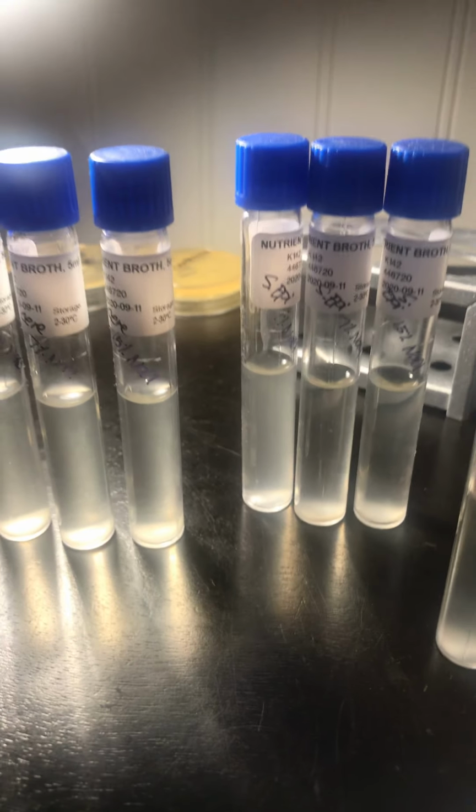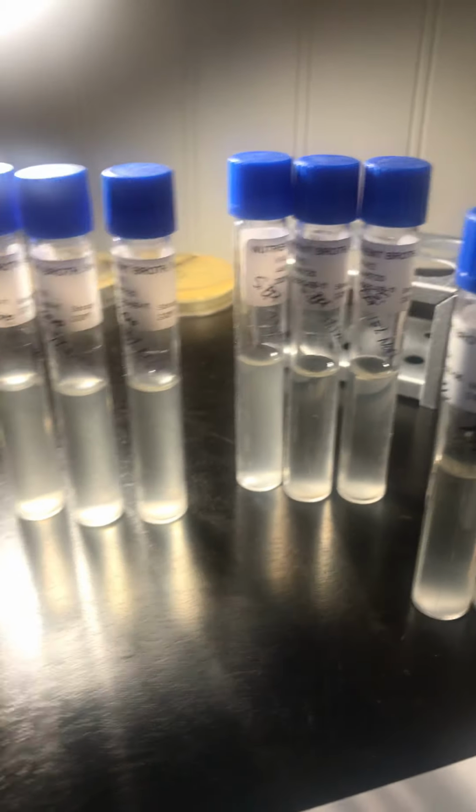In exercise 2, I will be preparing the pH broths. With the pH testing, I would need to incubate the S. cerevisiae and S. epidermidis culture broths with differing pH values to determine an approximate pH range for each microbe. The pH would range from pH 5 to pH 7 to pH 9, with pH 7 being the normal pH.